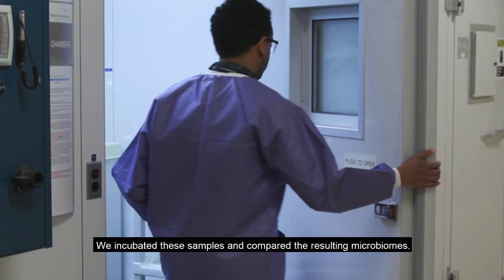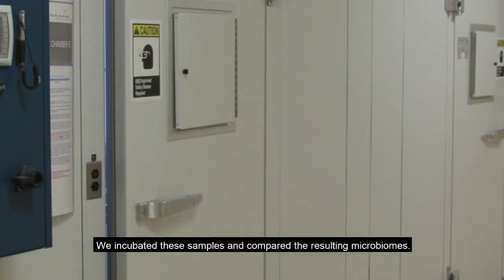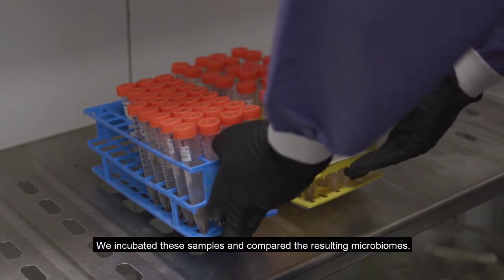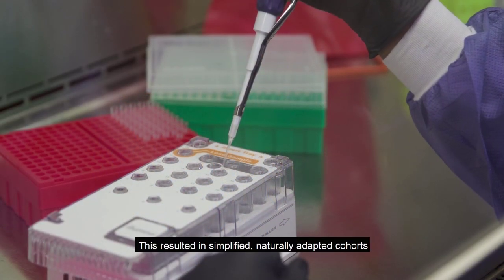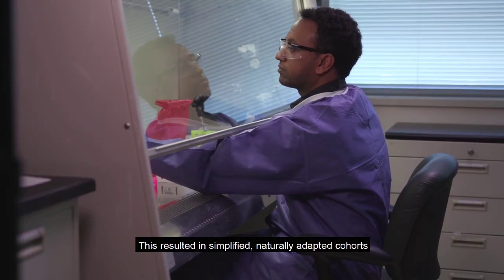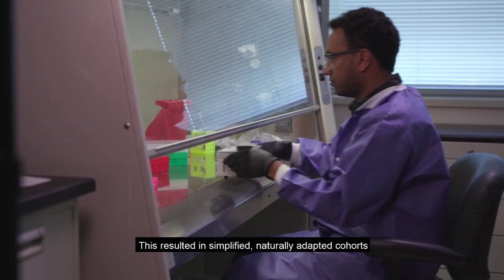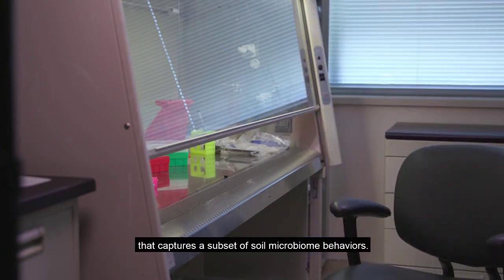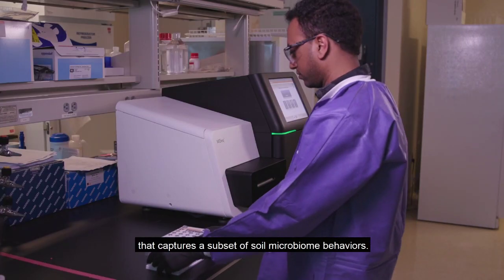We incubated the samples and compared the resulting microbiomes. This resulted in simplified, naturally adapted cohorts to serve as an experimental resource that captures a subset of soil microbiome behaviors.